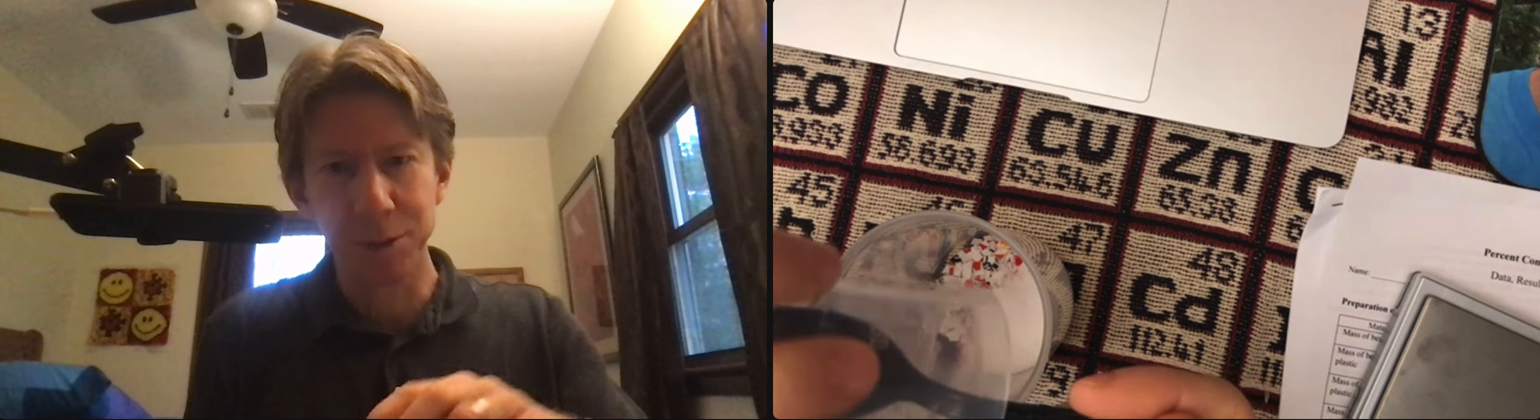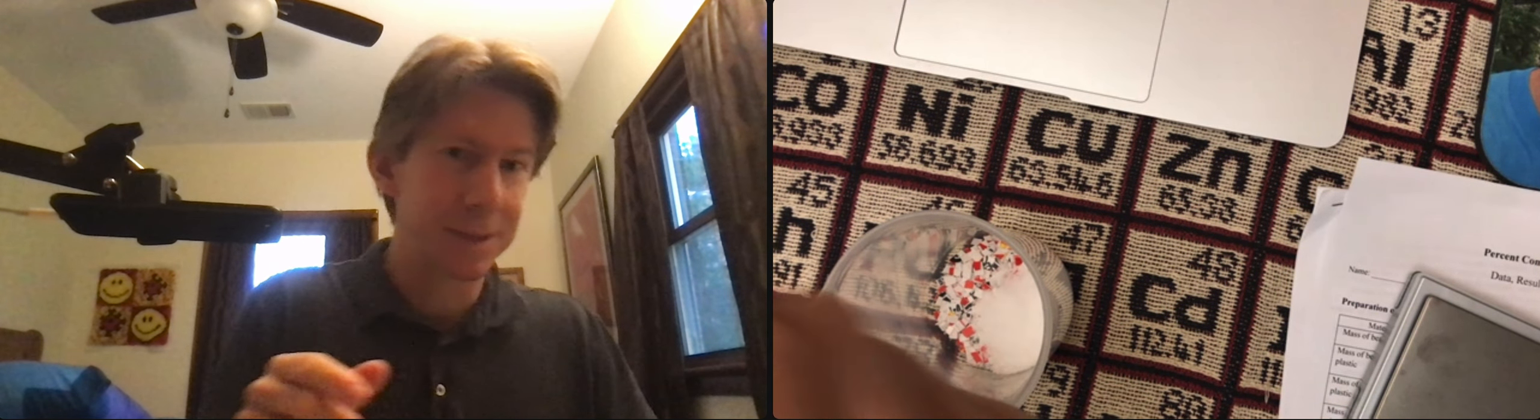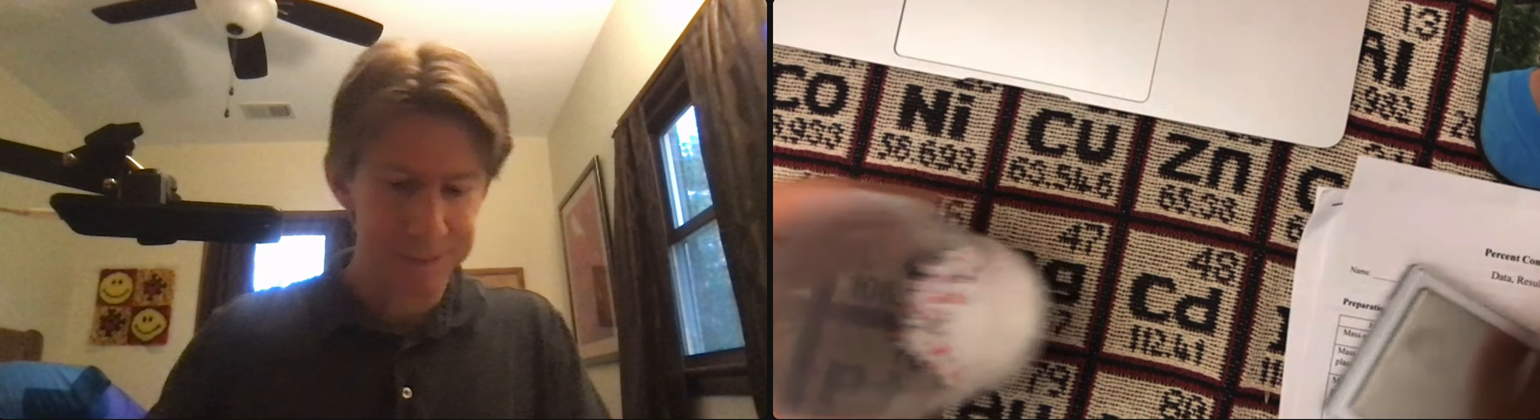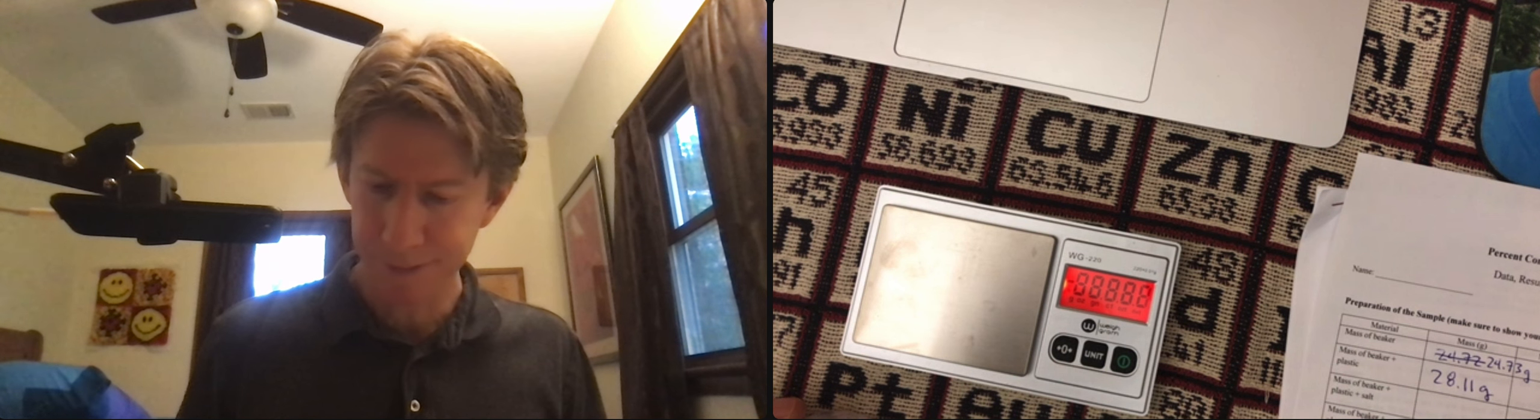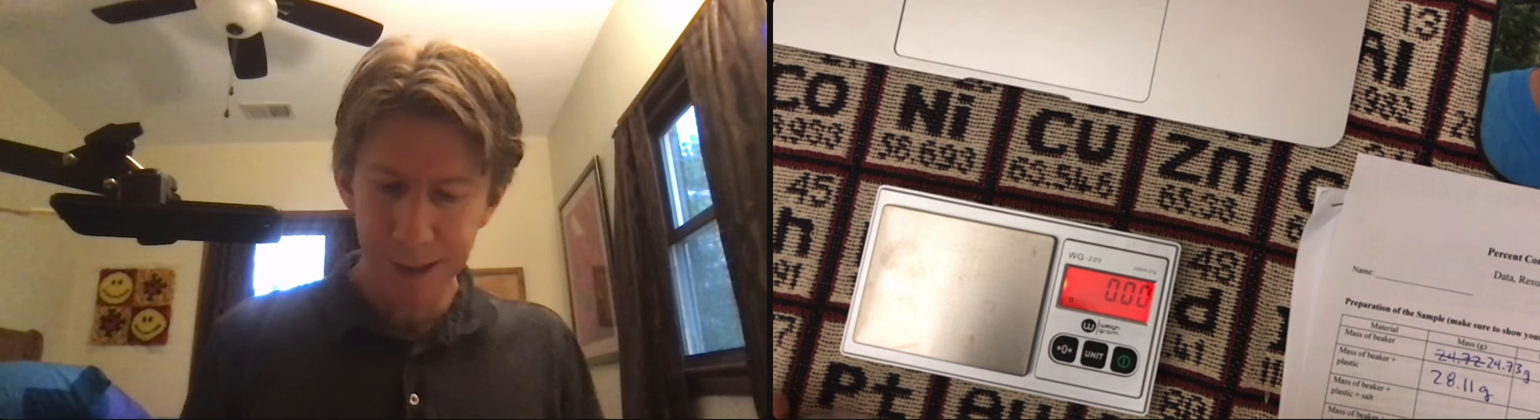I thought I got more than a spoonful but I did use a spoon to get it. All right, weigh it again.